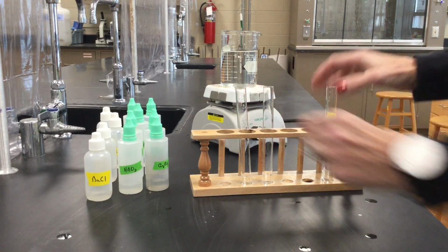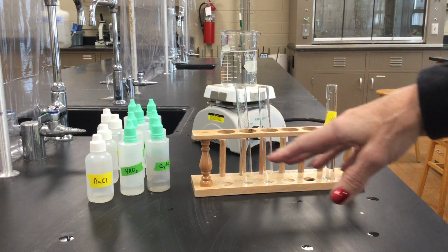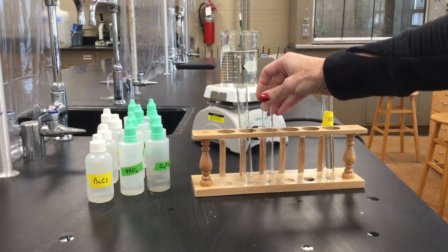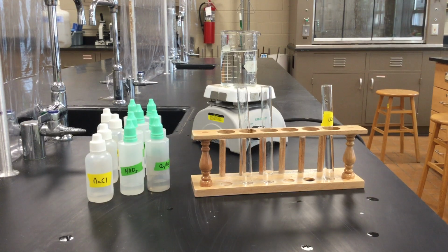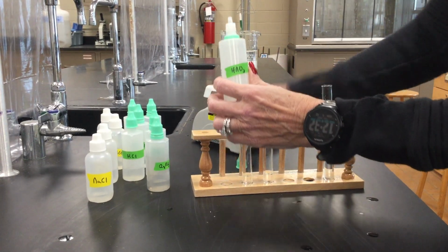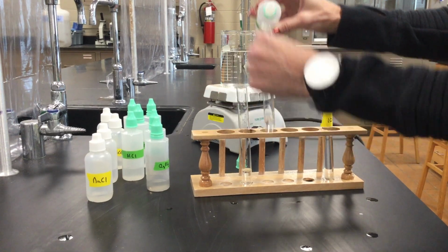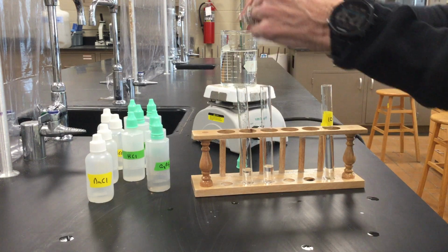Okay, so now if our unknown has chloride ion in it, when I add the other chemicals to it, it will do the same thing as the one with our known. So this one has the chloride ion in it. This one we don't know. So the next thing we're going to do is add some nitric acid. I know it says 2 milliliters, but again, we're not really too worried about amounts. And what I do to one, I'm going to do to the other. So I added that to the one that does have chloride ion in it. I did the same thing, about the same amount, to that one.